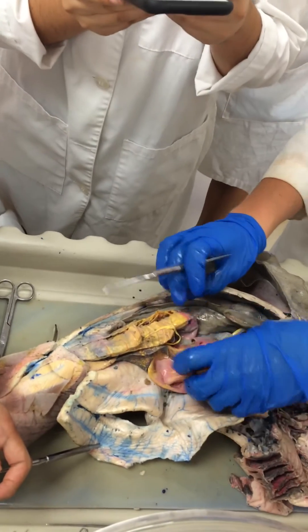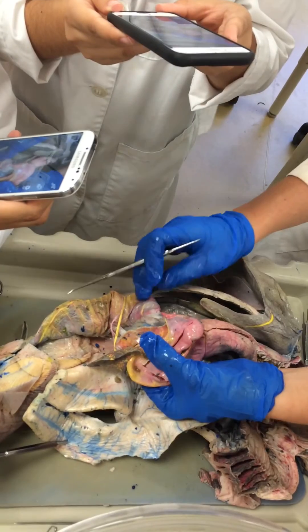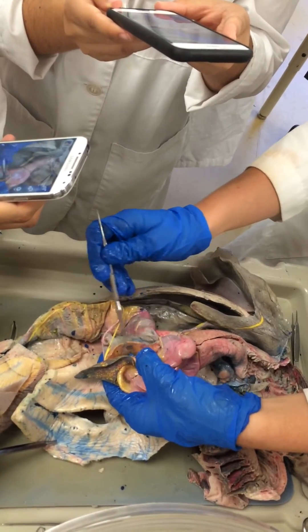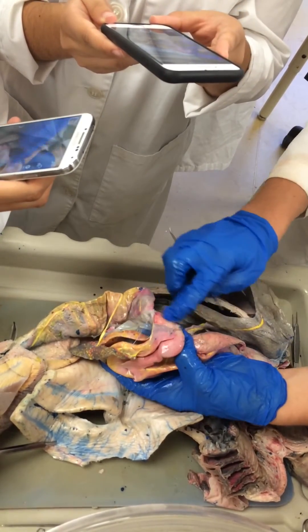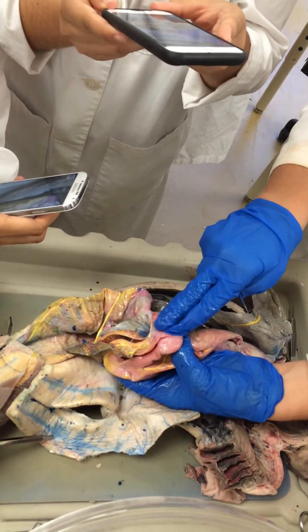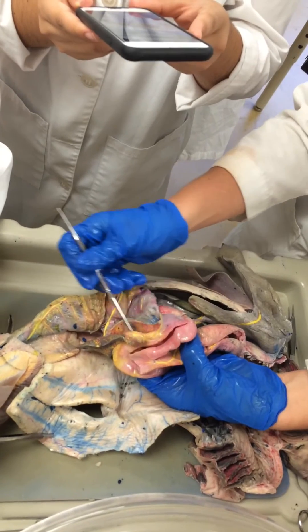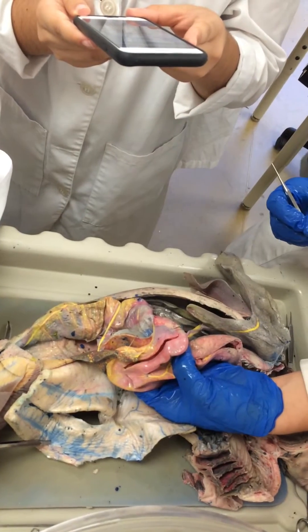One thing I wanted to mention is the pancreas. Below the pyloric region of the stomach and the spleen, you can see this dorsal lobe of the pancreas. This little part here with the same texture is the ventral lobe of the pancreas. It wraps around the duodenum area at the end of the pylorus. The part connecting the dorsal lobe and the ventral lobe of the pancreas is called the isthmus of the pancreas.